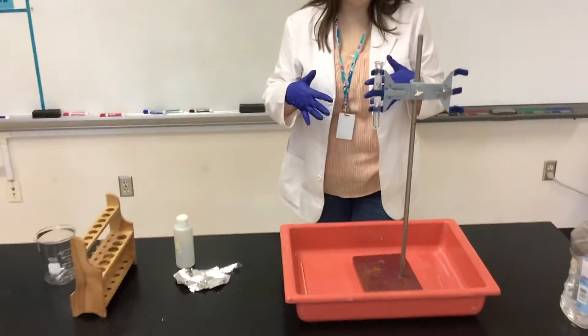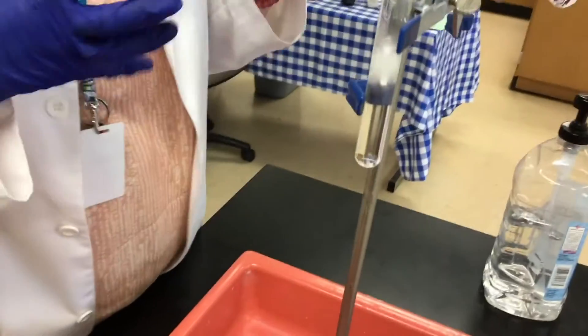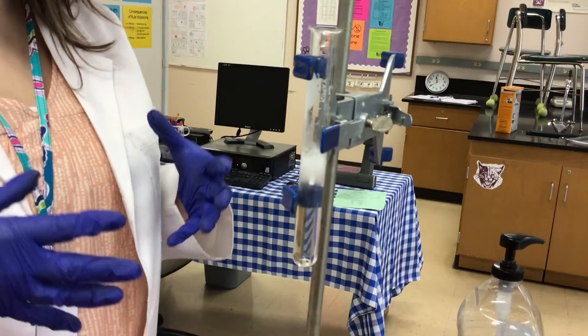You can instantly see that a reaction starts. You can see some smoke coming out the top. This is an exothermic reaction, meaning it releases heat.